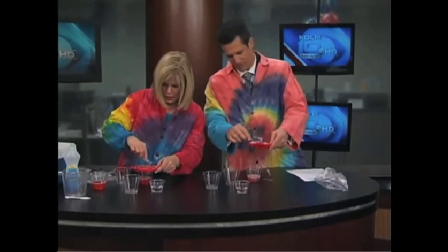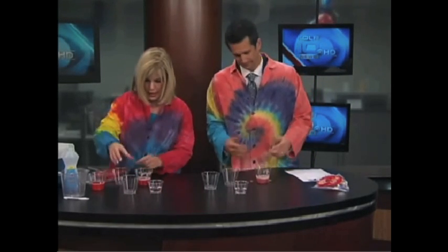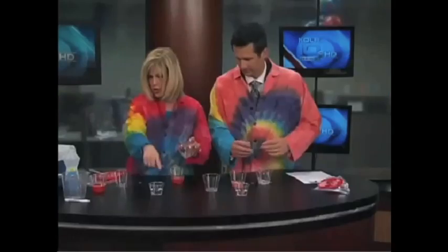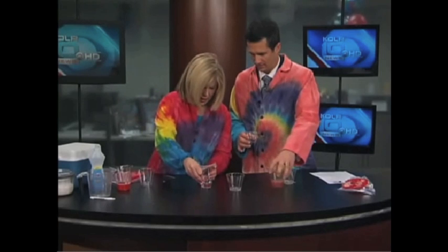We've got it strained down as much as we can. Let's take that and pour it into another empty cup. I have chilled the alcohol — this is just rubbing alcohol and I have chilled it. It's important that you chill it to get a good extraction.